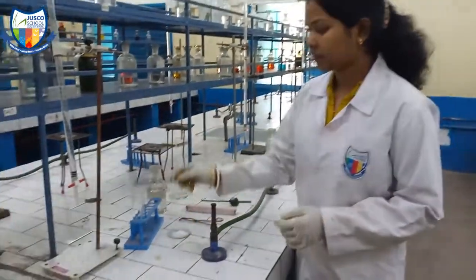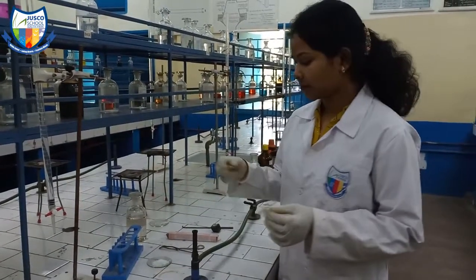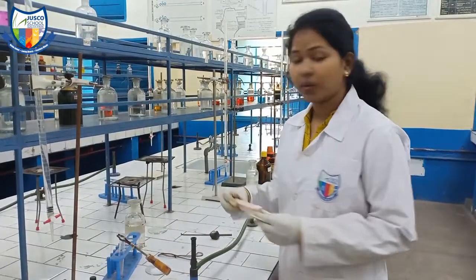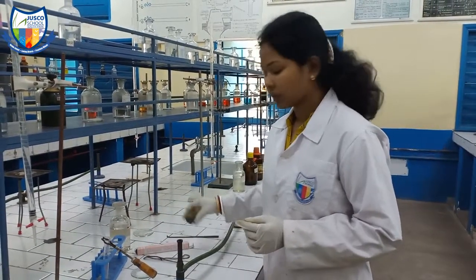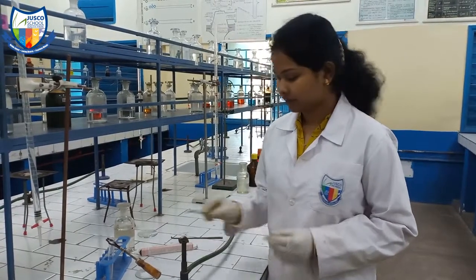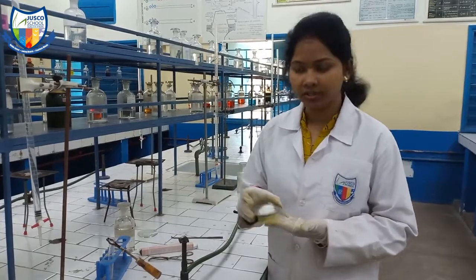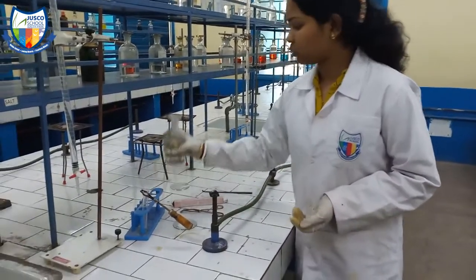For this experiment we need a few materials: a test tube, test tube stand, test tube holder, platinum wire, charcoal cavity, the unknown salt, and dilute HCl.